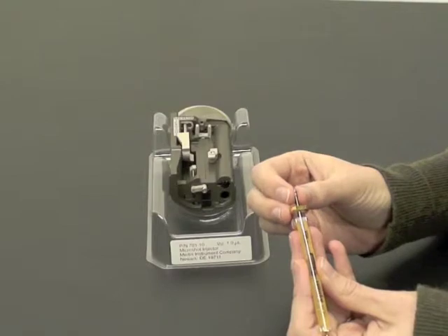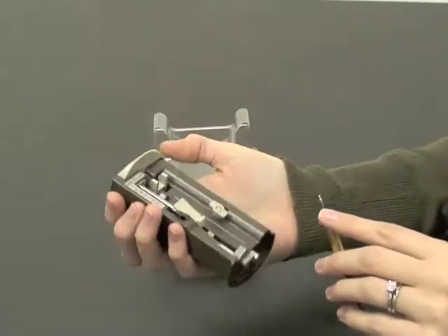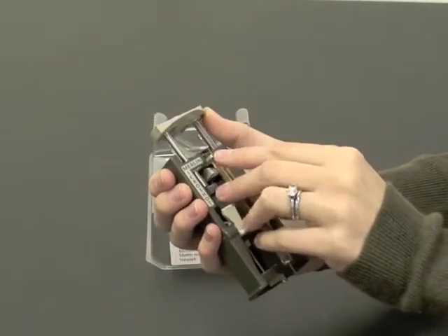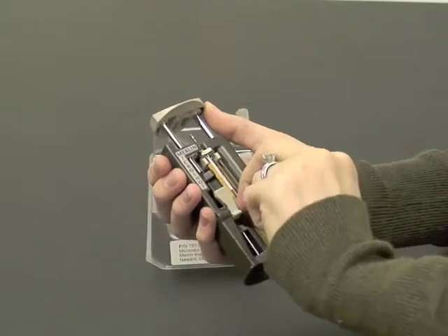Installing the syringe is simple. Pull the syringe plunger up slightly. Raise the spring-loaded plunger slide. Slide the syringe flange under the clamp and twist the syringe latch.